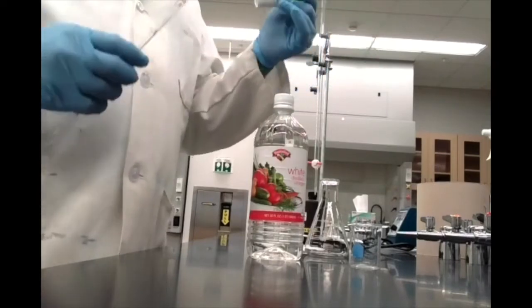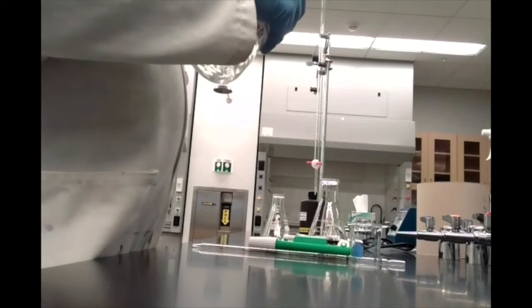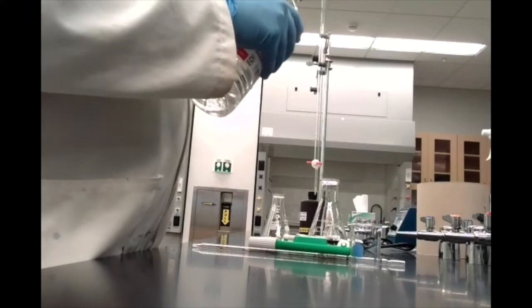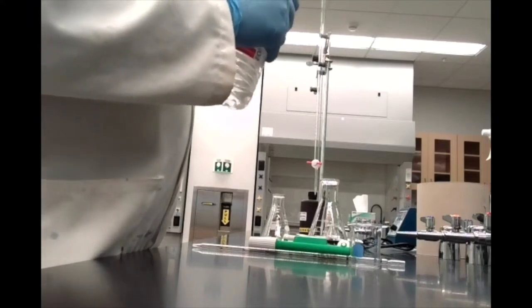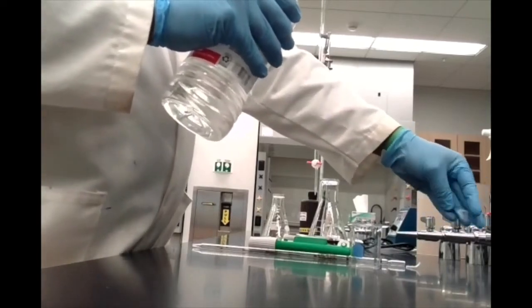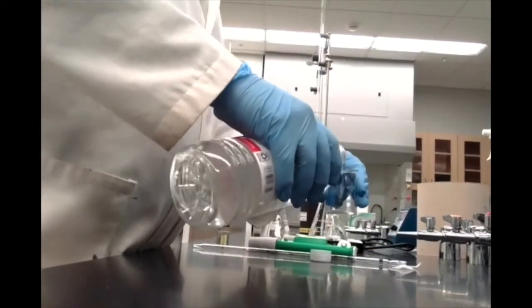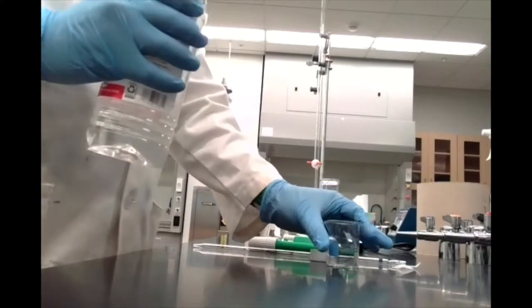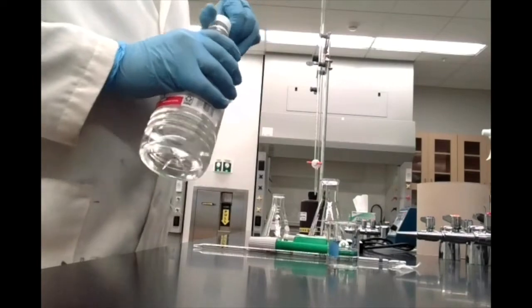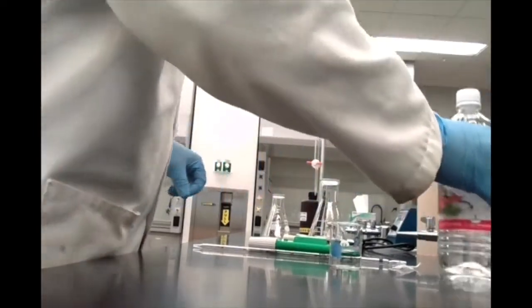allow us to measure volumes very precisely and very accurately. I'm going to start off by pouring some vinegar into a beaker here. That'll make it a little bit easier to deal with trying to get a volume of vinegar. Plus, it prevents me from contaminating our stock bottle of vinegar here. So let's pour some into a beaker. We're going to need to do 3 trials here, so probably need about 15 mils or so of vinegar. I've definitely got more than enough in there.